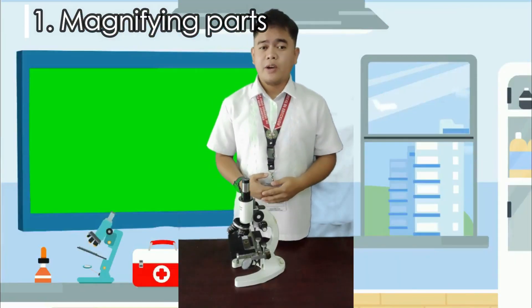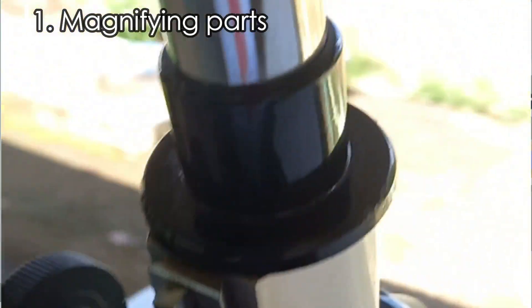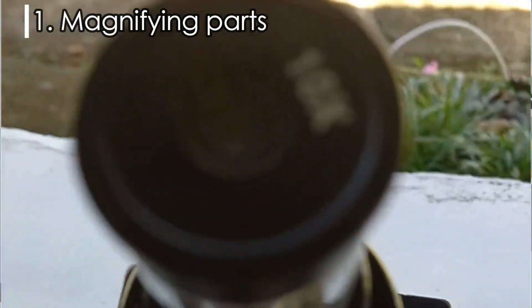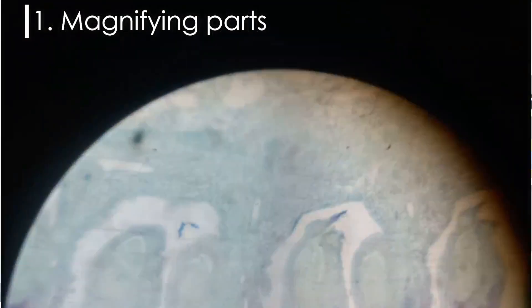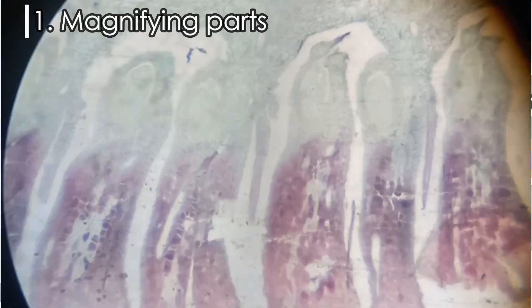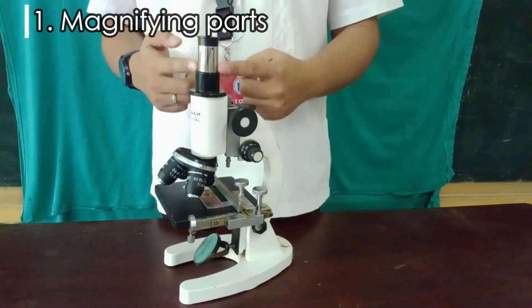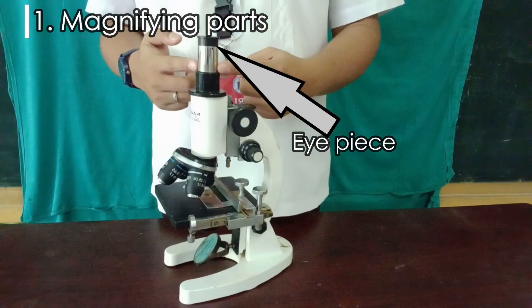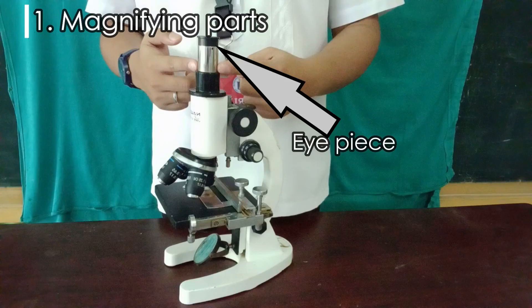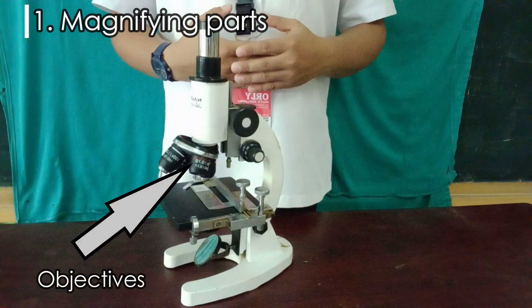Magnifying parts are parts of a compound microscope that make the specimen in focus appear larger. It includes the eyepiece, a lens that is attached to the draw tube, and objective lenses, which magnify the specimen under observation.